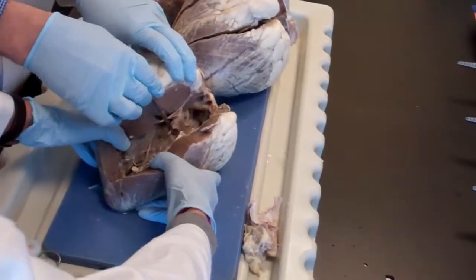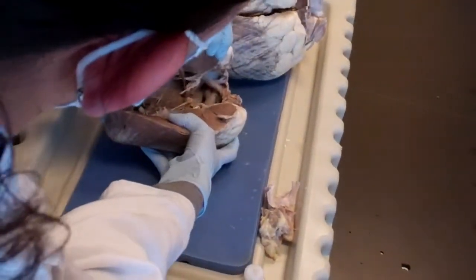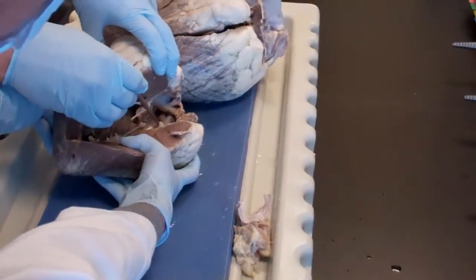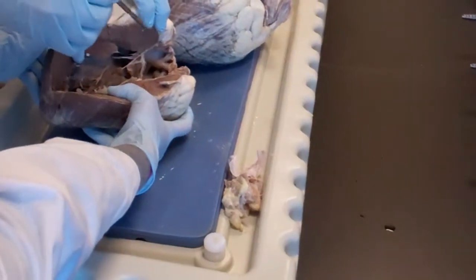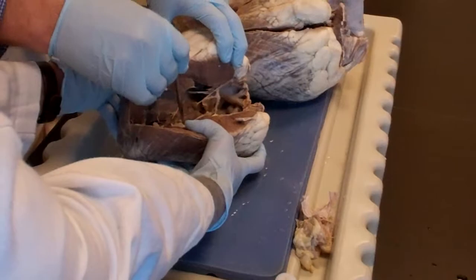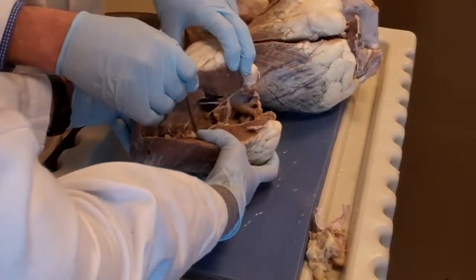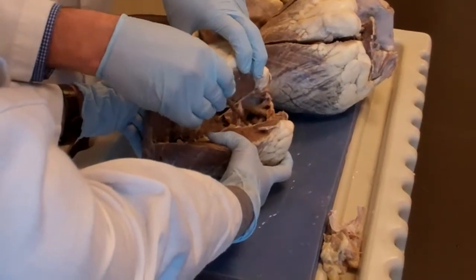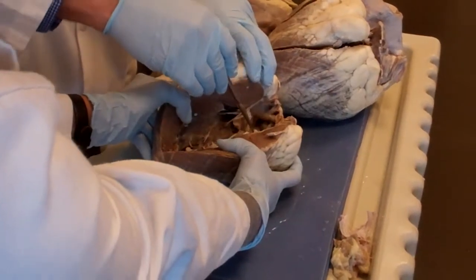Right here. See the chordae tendineae? Tilt it towards them, please. There we go. Come closer, senorita. I'm not seeing anything. Here are the leaflets, 2, 1, and 2, of the mitral valve, or the bicuspid valve. Very thick muscles are budding out from the ventricle wall, and these are the chordae tendineae attached to the muscle, to the leaflets of the mitral valve.